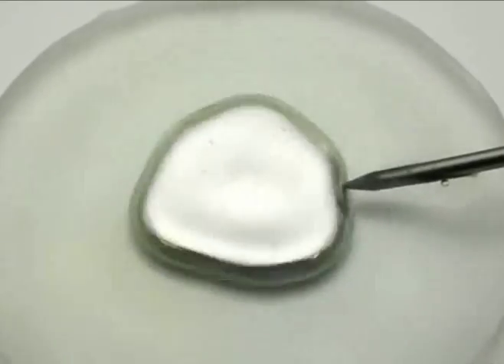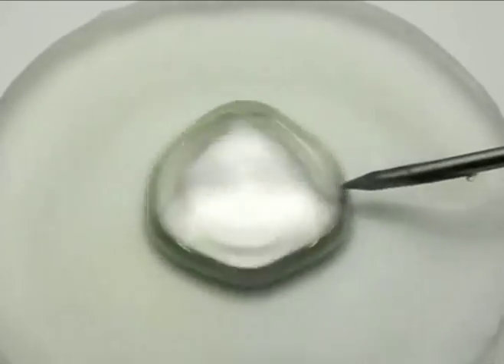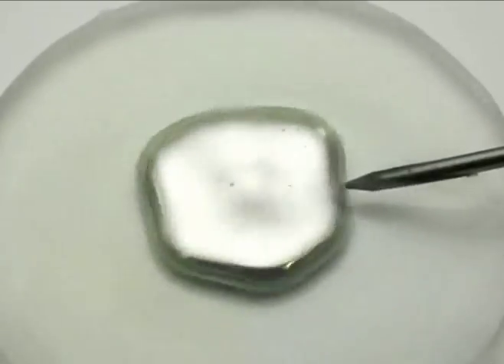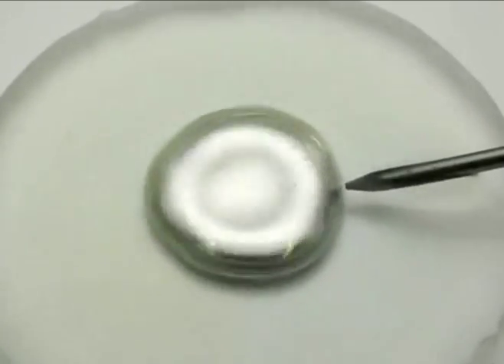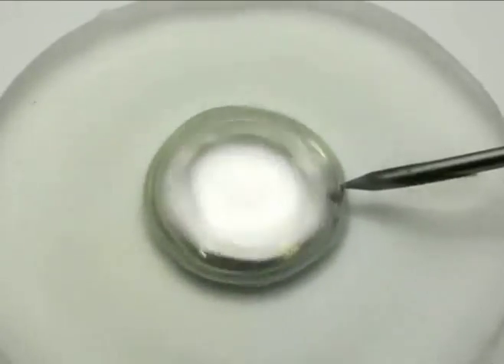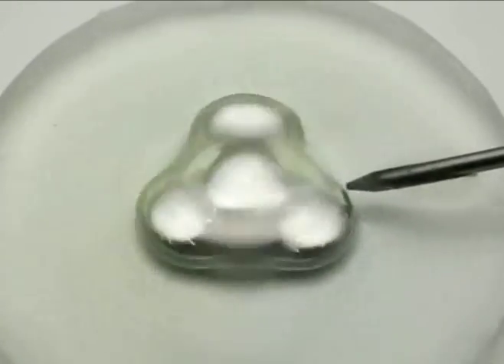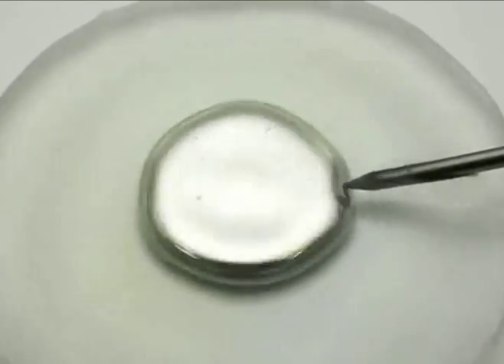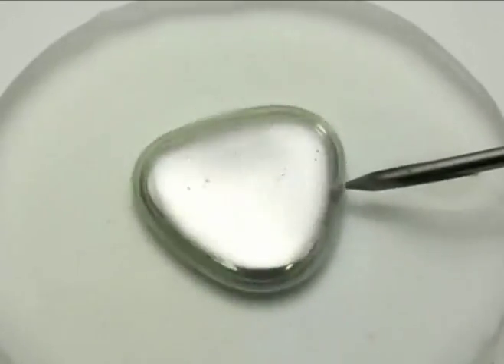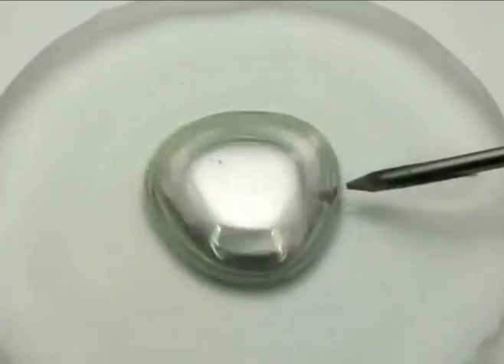The solution contains an oxidizing agent that removes electrons from the mercury, giving it a positive charge. The positive charge decreases the surface tension of the mercury, causing it to expand. When the nail touches the mercury, it transfers electrons to the mercury, reducing the charge.